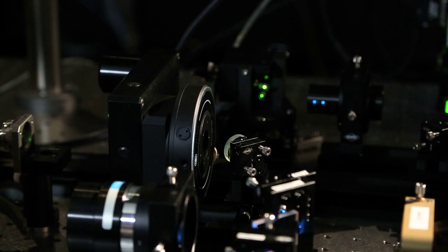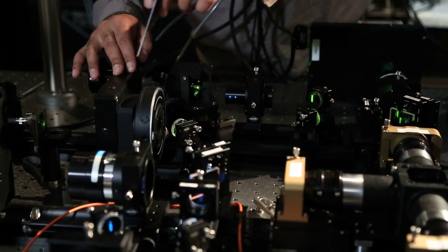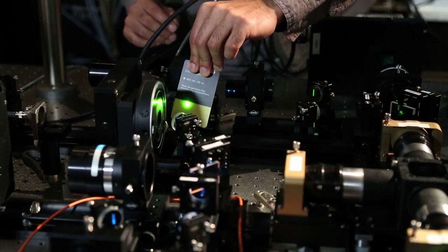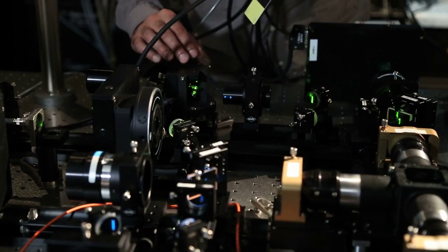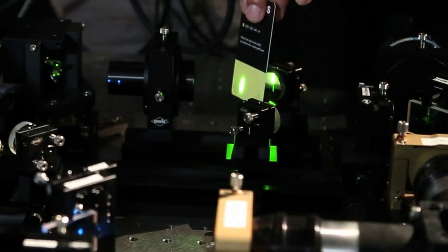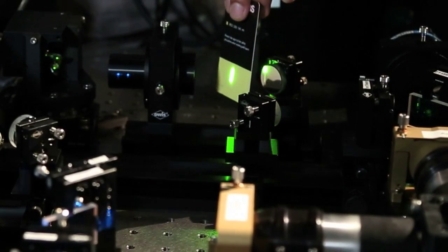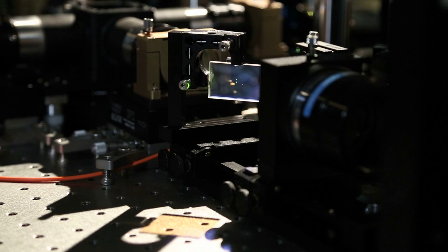Let's go ahead and trace one of the illumination paths here. We have a laser beam coming in and passing through the illumination filter and a shutter. As you can see, this is a Gaussian beam that is now going into the XY galvo scanner. What this element does is it generates the light sheet. As you can see here, it scans the beam up and down, and once it's done with the up and down scan, it does the lateral scan. It's doing up and down really rapidly, so for our eye, it almost looks like a line, and it's doing the sideway lateral scan.